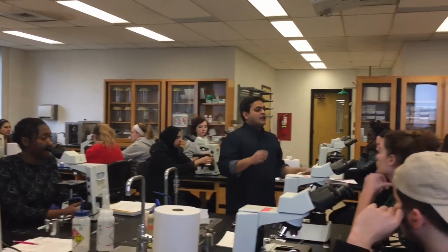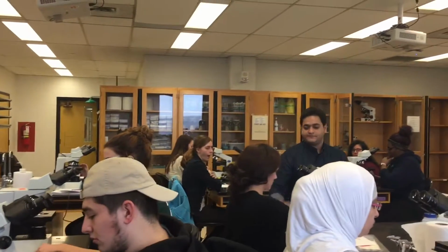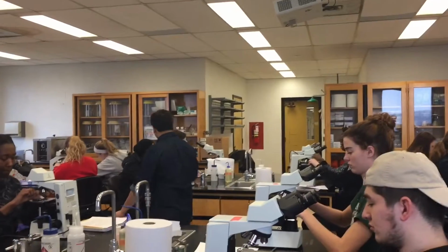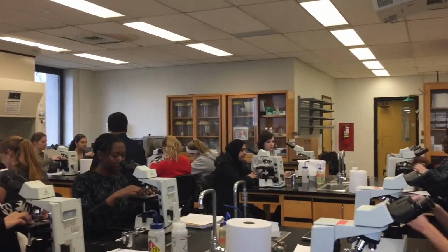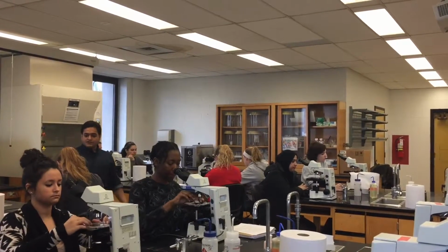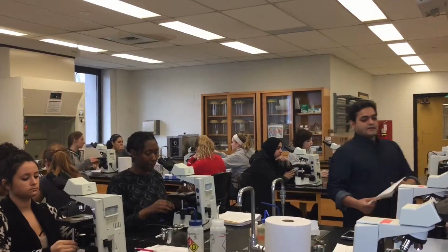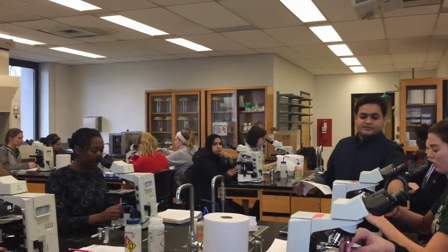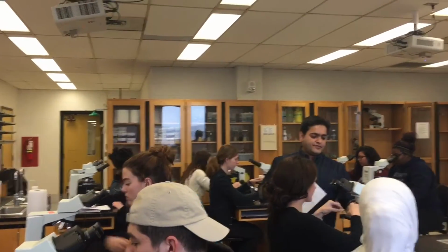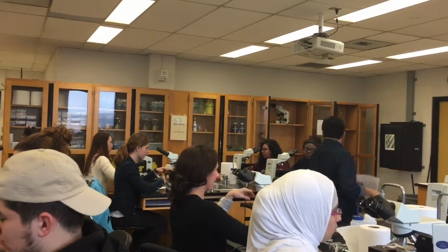Okay. Now, next thing you're going to do is you have the slide. You put it on the stage. Go ahead and do that. It should be sitting on the stage perfectly. That's good. It should be going into the slot of the stage. Yep. Pull this one. No worries. Just put it like this. Yep, good.